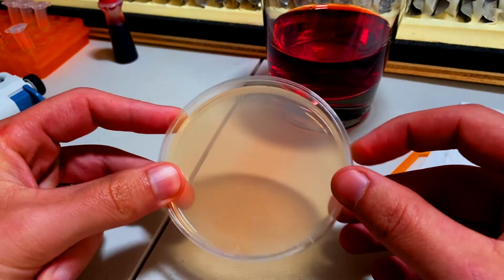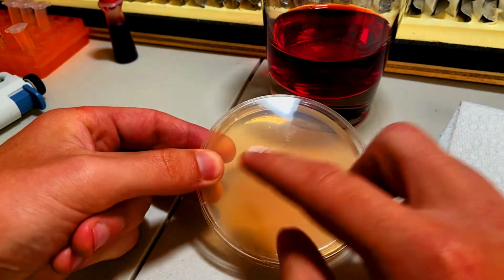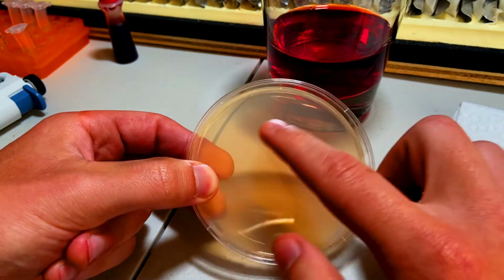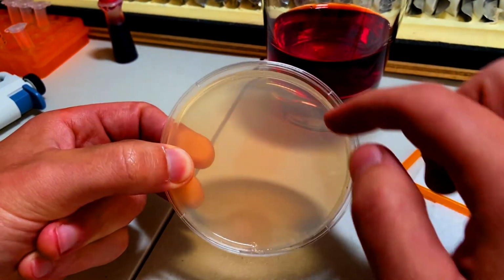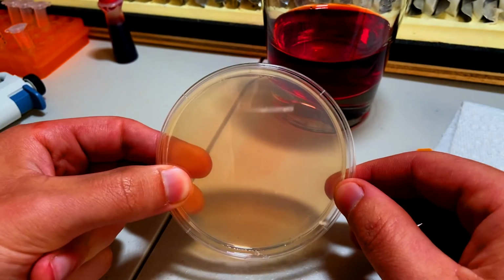That being said, on my plates, I often notice some colonies around the outer edges and none in the middle. So I think when we're trying to confirm our transformants worked, what we really want to see is growth in the middle of the plate, because that will rule out the fact there might be colonies growing in an area where maybe the antibiotic didn't reach. Okay.